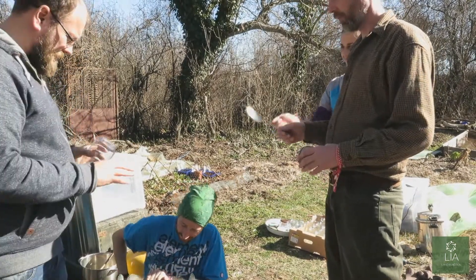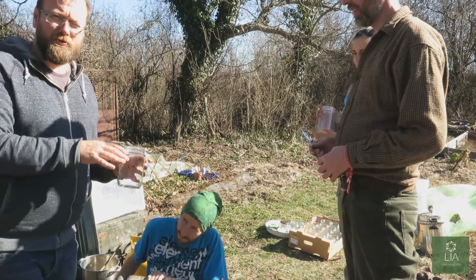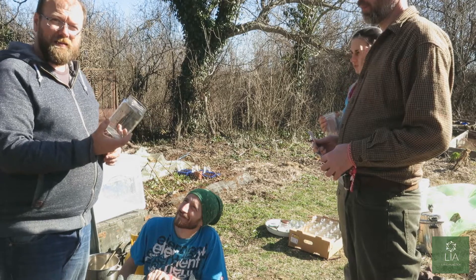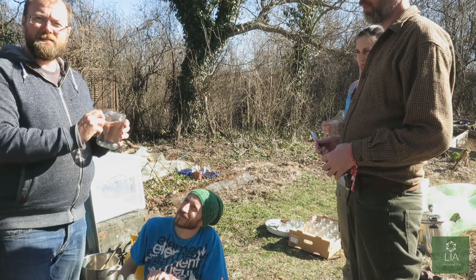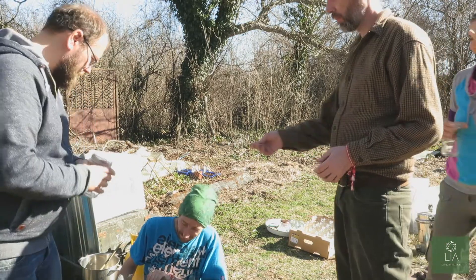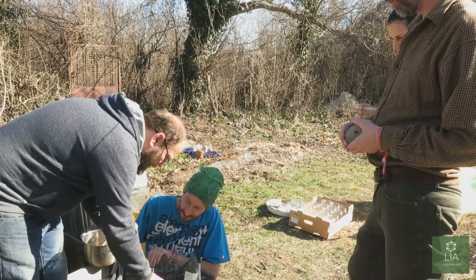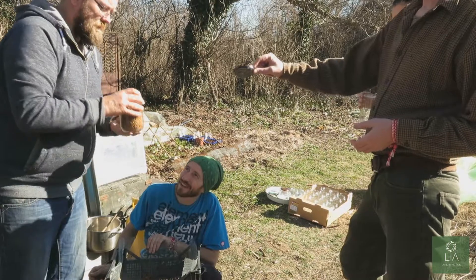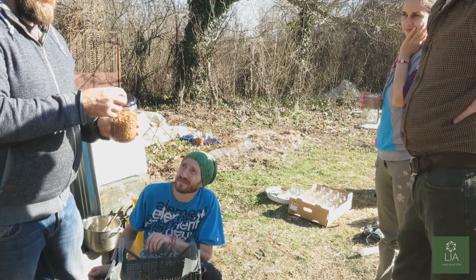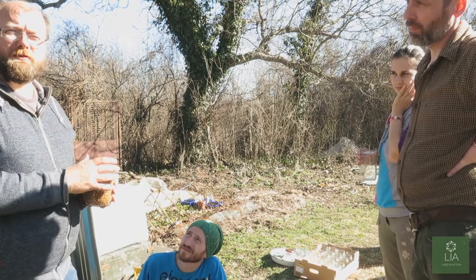The rye is cooked and dried. We're now going to fill the jars. Our pressure cooker holds about eight 750 milliliter jars. We're going to fill them to three quarters because we want to add mycelium to these later. We put the lid on, then fill the hole with some filter material, and put some foil over the top before transporting them into the pressure cooker.